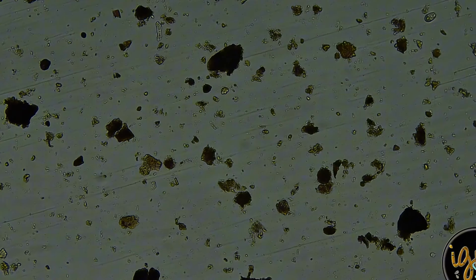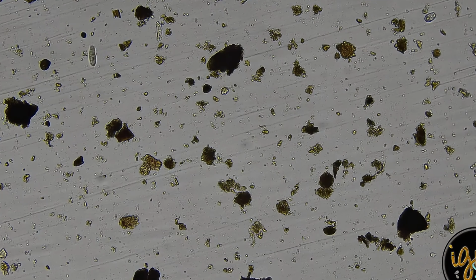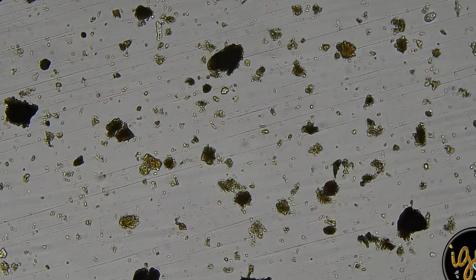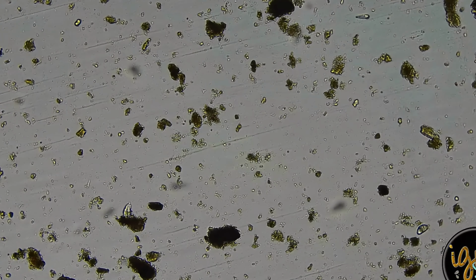Well, I can't stay at 100 because I keep having to dive in. You've got a couple ciliates. They say that you don't want to see too many ciliates.